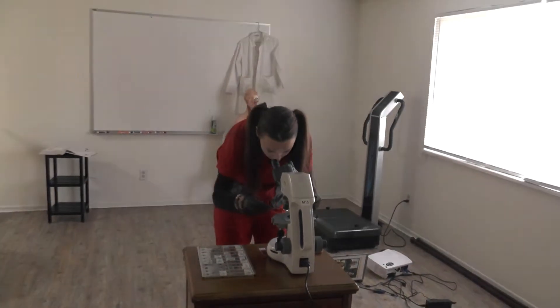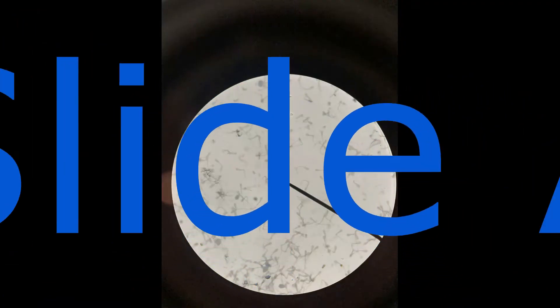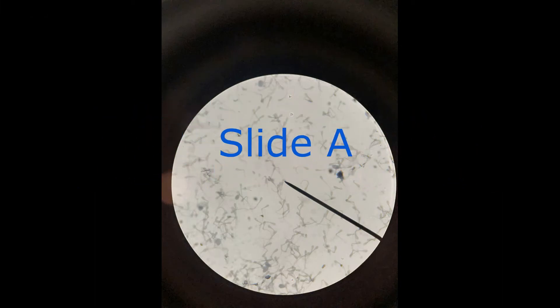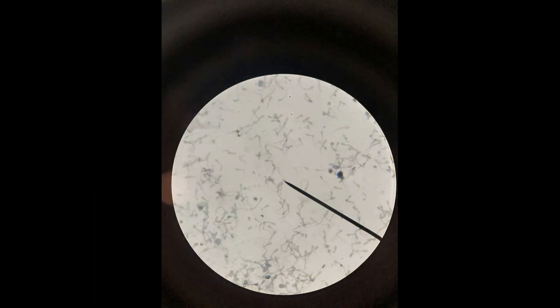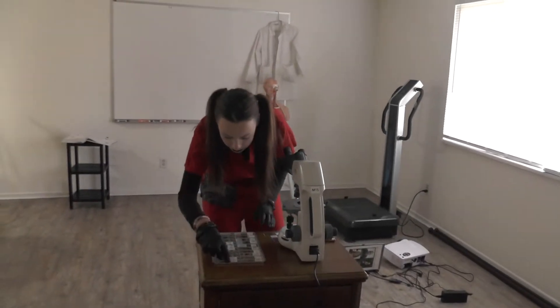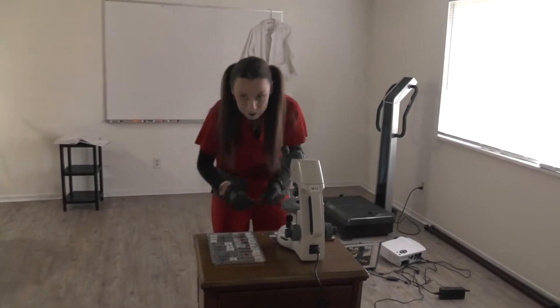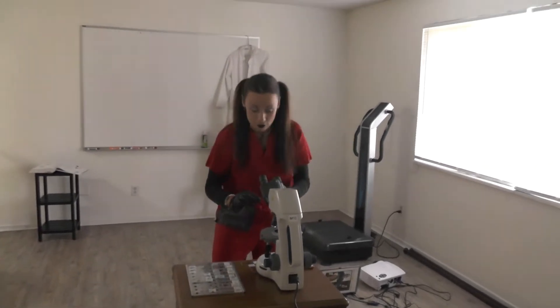We can take a look at some bull sperm. So, what else do we need to look at? Let's look at a testicle.